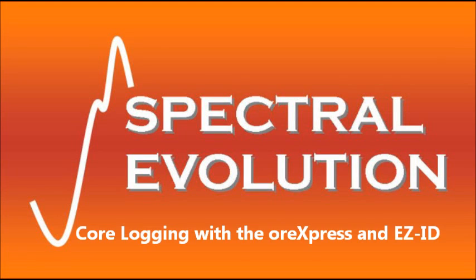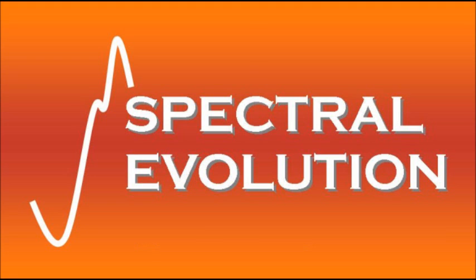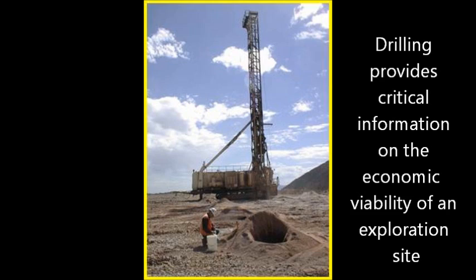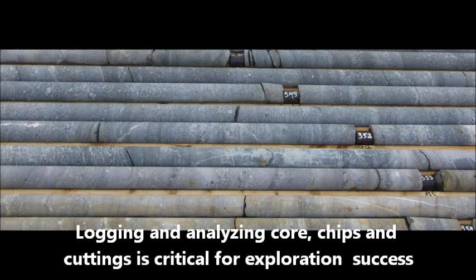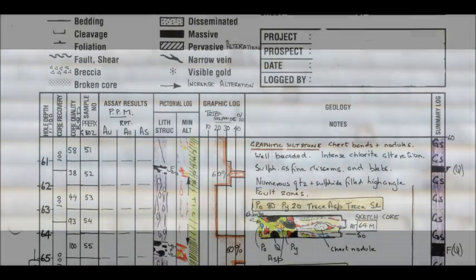This video describes using the ORExpress Field Spectrometer with EZID software for core logging. Drilling gives geologists the critical information necessary to determine if an exploration site will become a mine. Drillcore provides vertical samples of the underlying minerals of an area so that a geologist can make an in-depth geological map. Drillcore can tell an observant geologist what they have drilled and suggest where they should or shouldn't continue to drill.